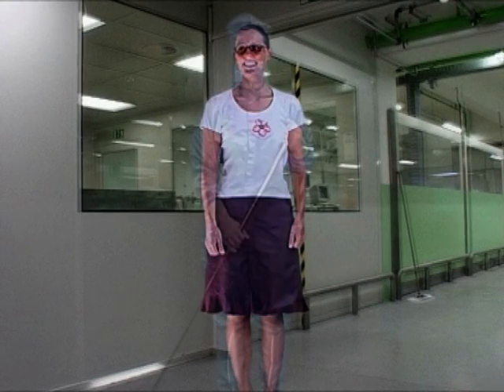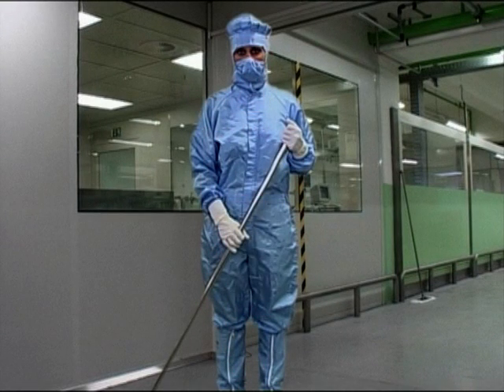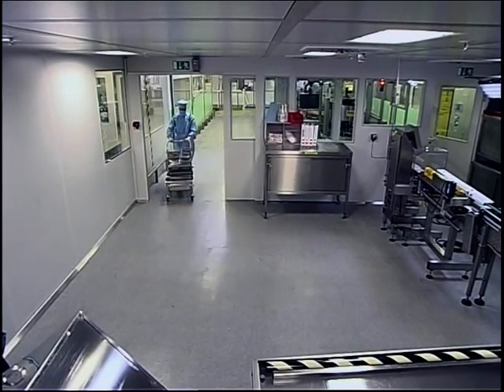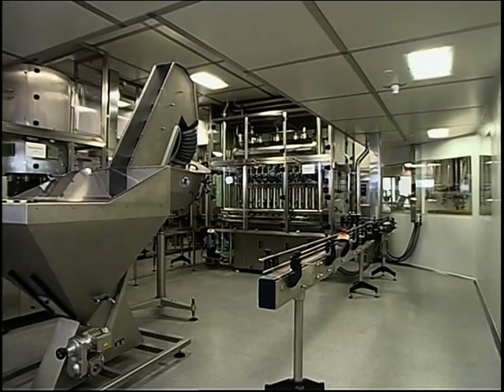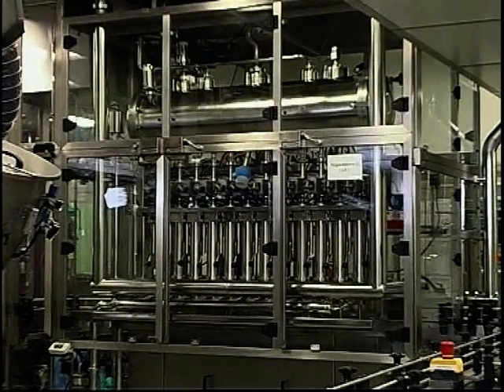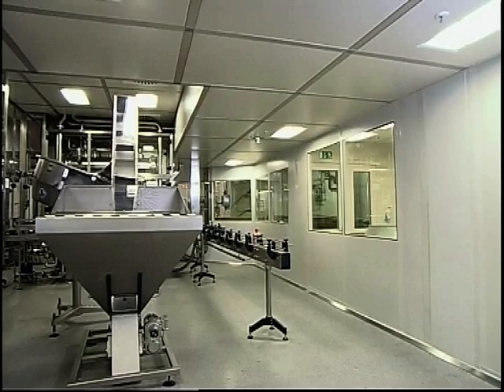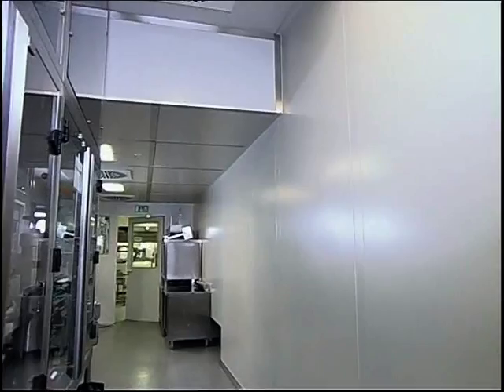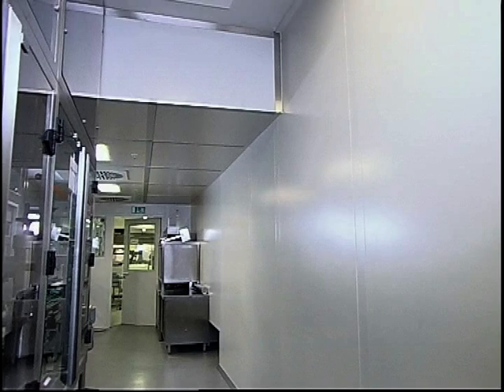If we now go into the clean rooms, you are, of course, already dressed properly. Naturally, you know that clean rooms are separated from other areas by airlocks in the interest of safety. Let's look at all the things that have to be cleaned and disinfected. There are the machines and apparatus, the fixtures and fittings, the working surfaces and the windows, the floors, the ceilings and the walls. We will show you later how these are treated.